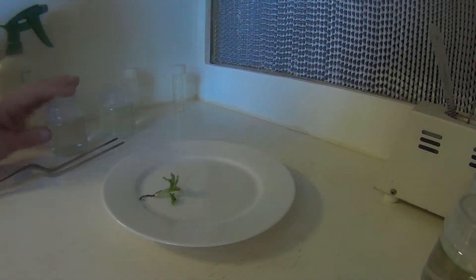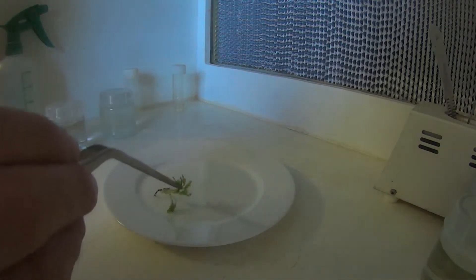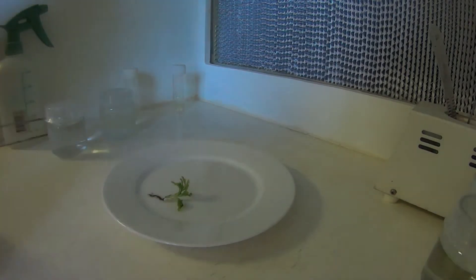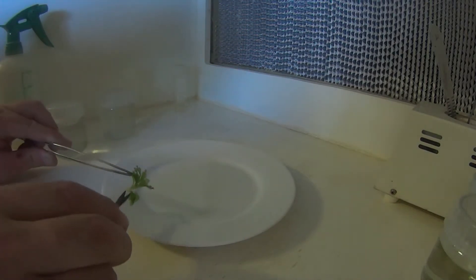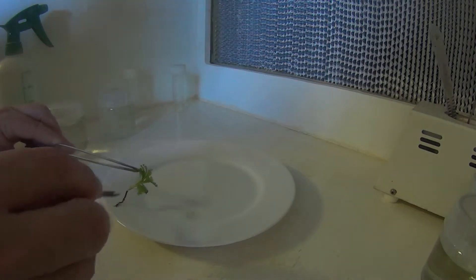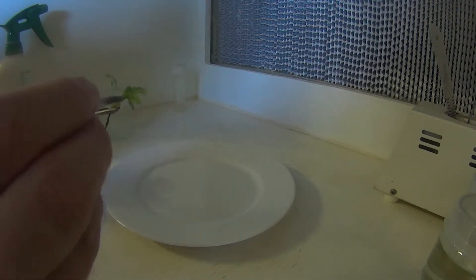It's been just rinsed and soaking in water for a few hours, trying to get some of the dirt off. The best part I find to use for tissue culturing Venus Flytraps are a young shoot usually coming out of the middle here somewhere.